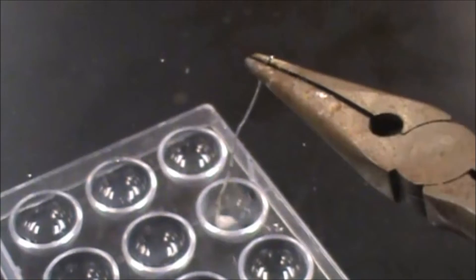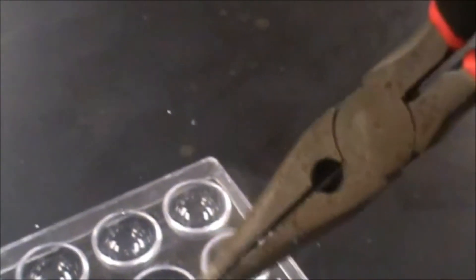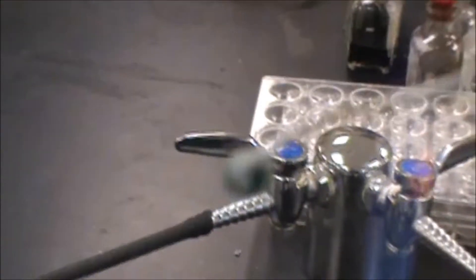There's our bead. We're going to dip that into our chromium, make sure we get plenty. Now we have a green color to it.